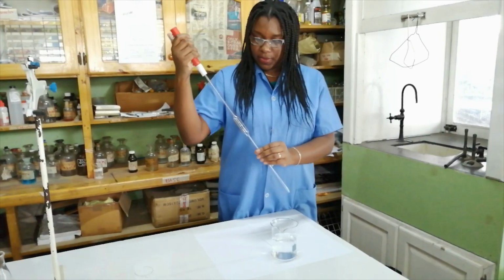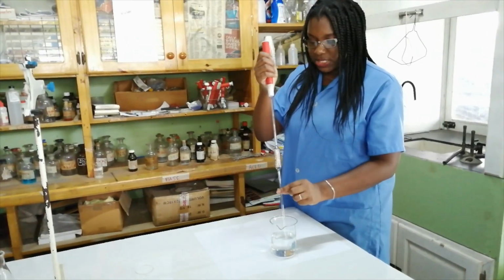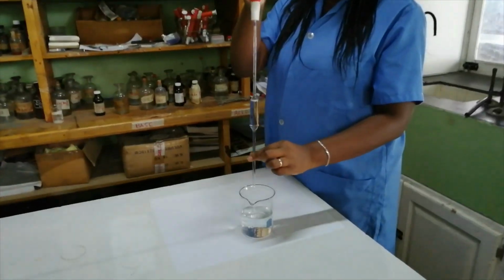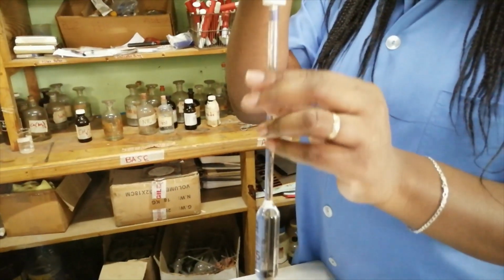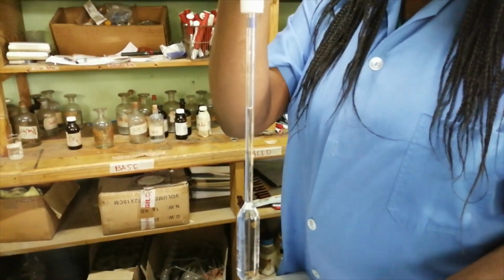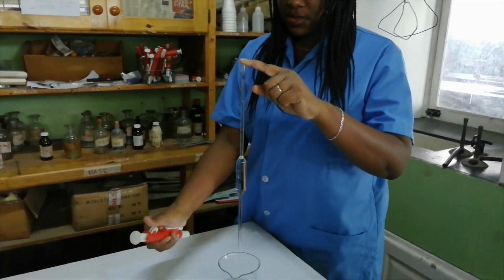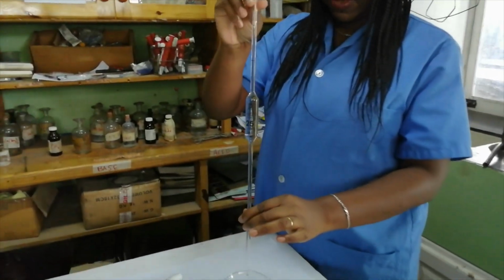So when you're doing your pipetting or you're filling your pipette, this is operated just like a straw. So once you wheel this down, then of course a suction is created that will pull the liquid up into the pipette. At this point, what you can do is actually use this lever right here to transfer it, but I prefer to use my index finger. So I'm going to take the pipette filler off it and stopper the liquid in there with my index finger.